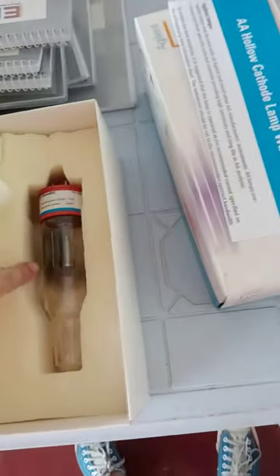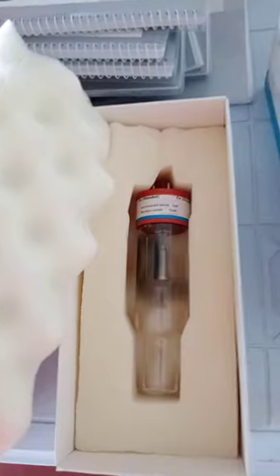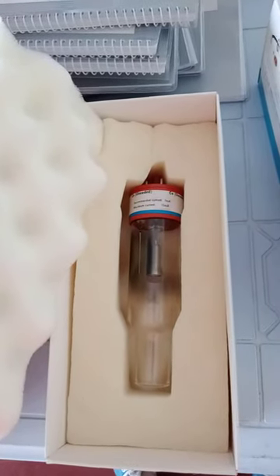Here is the Agilent lamp. If you open it, you would see — you can see some burnt things there, like carbon things. But this actually is not used for certain occasions; this is only used for testing. So it means that this one has been tested already.